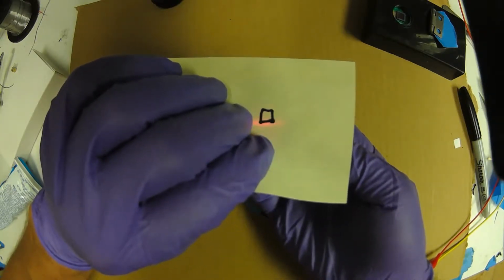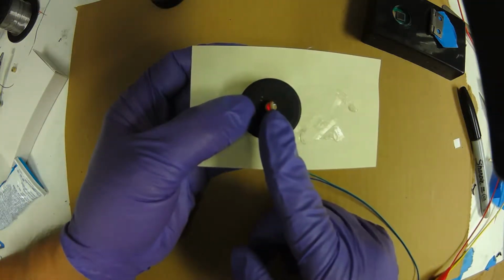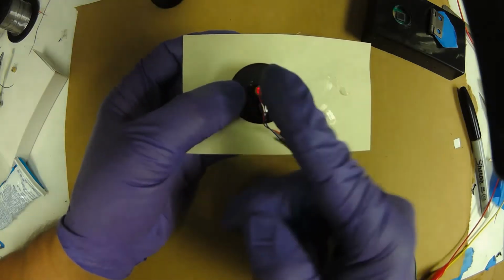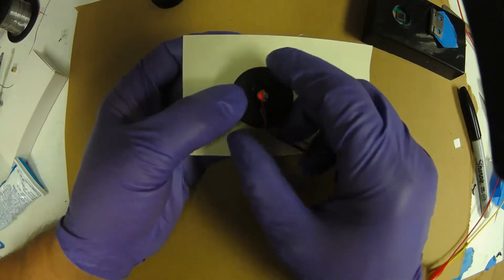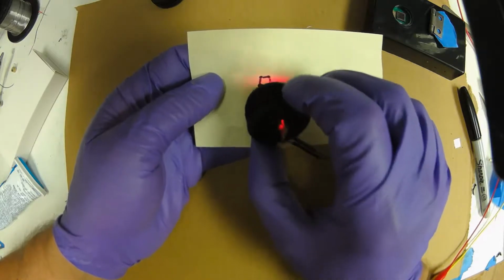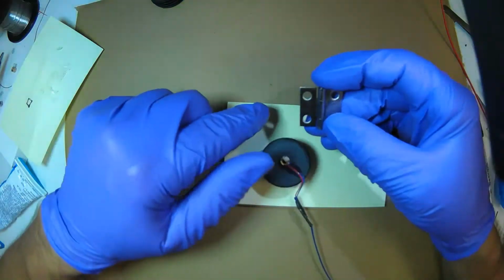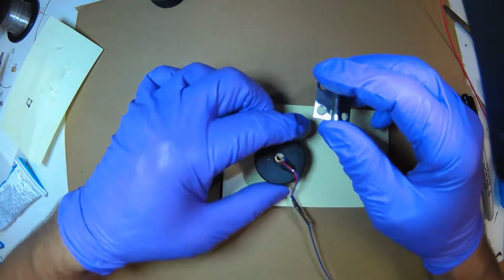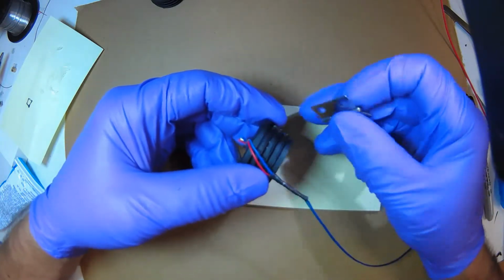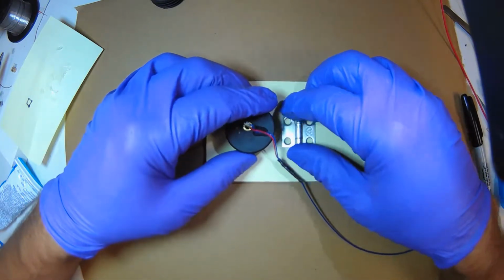So we're going to then orient the board so that the hinge is orthogonal, at right angles, to the circuit board. That way the beam will be parallel to the hinge, and we can slide it up and down to align it. Let's attach the hinge to the cap. Notice that we've got a cylinder meeting a flat, so it only meets in a line, but hot glue is going to save the day.